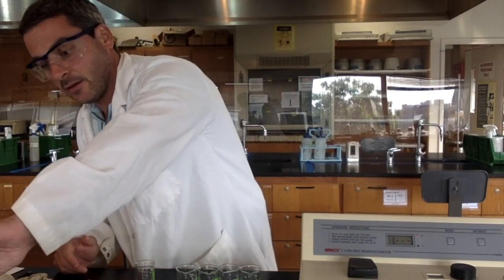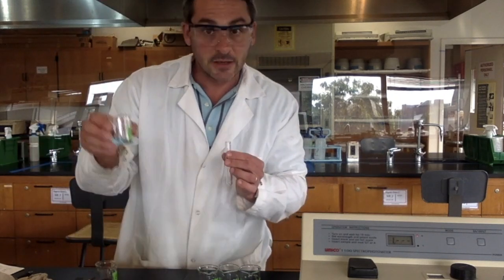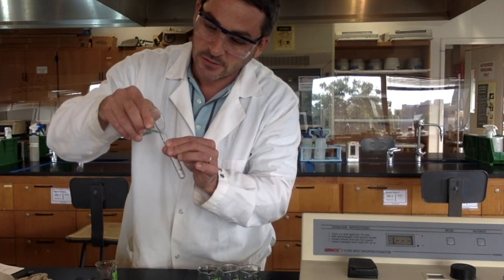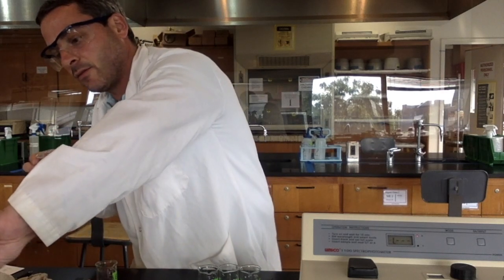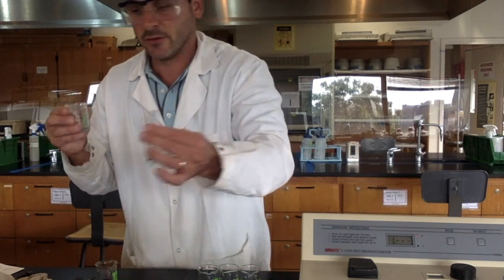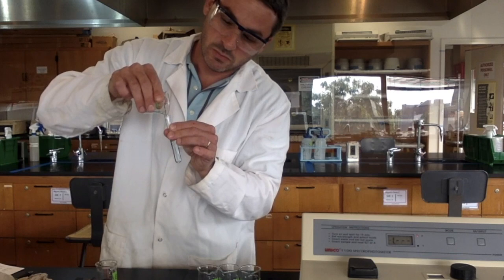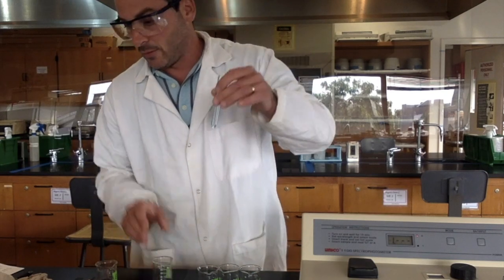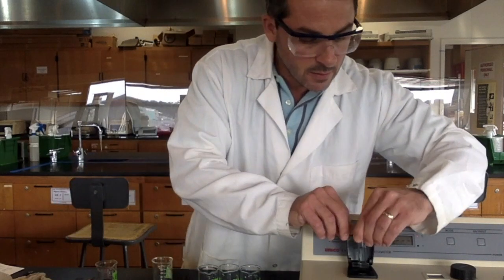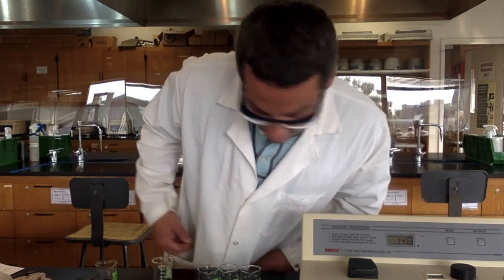So I take E, dump it in my waste beaker, get as much out as you can. Then I'm taking solution D, a little bit, and I'm rinsing it with the solution I actually want. So whatever gets trapped in there should be my solution. Pour that in. Remember, no bubbles, no fingerprints. And now my concentration should go up. 0.146.